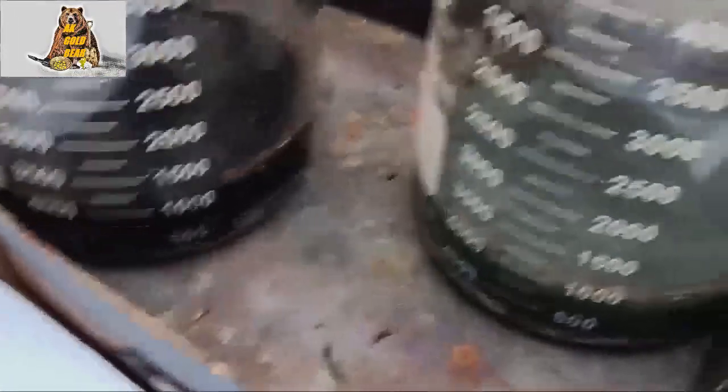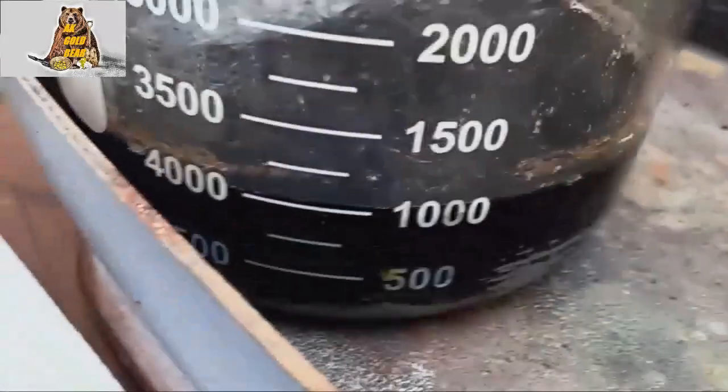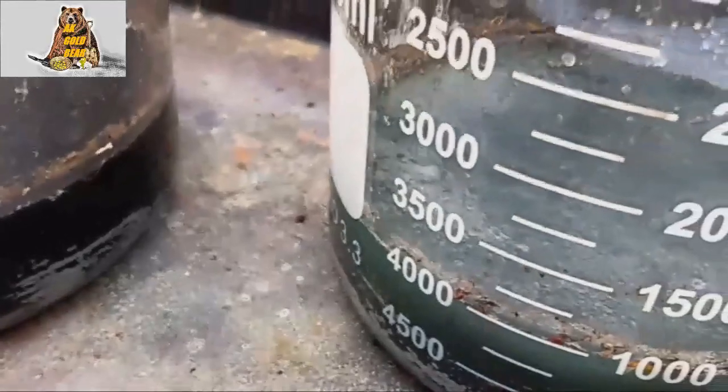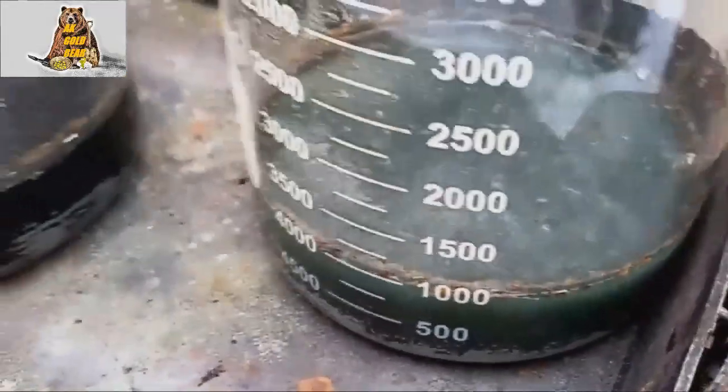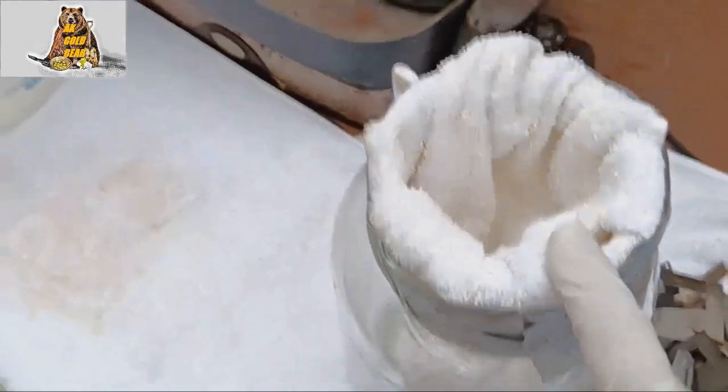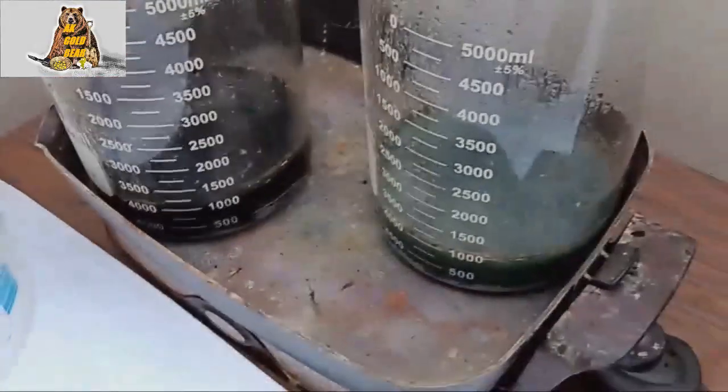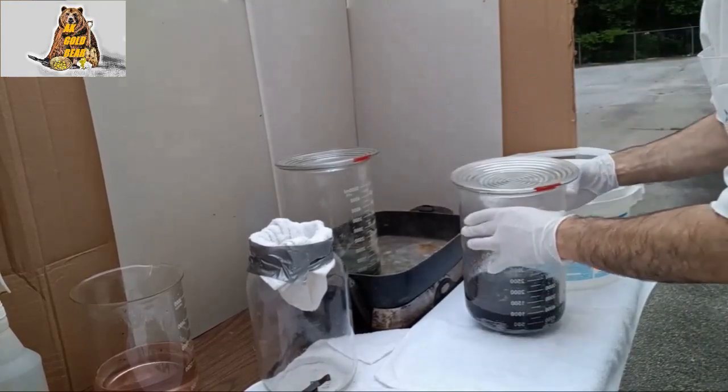So, sulfuric acid now is not active. See, here, no any bubbles. It's very important, very important. If sulfuric acid is still active, acid will destroy your filter. It's very important.